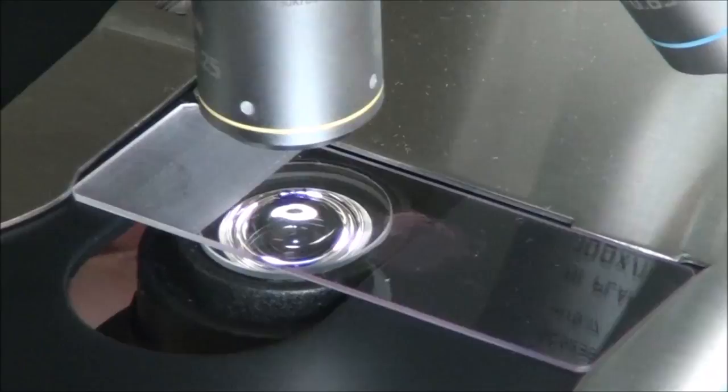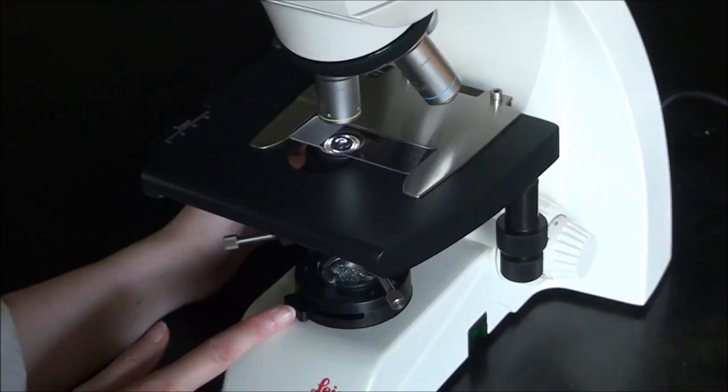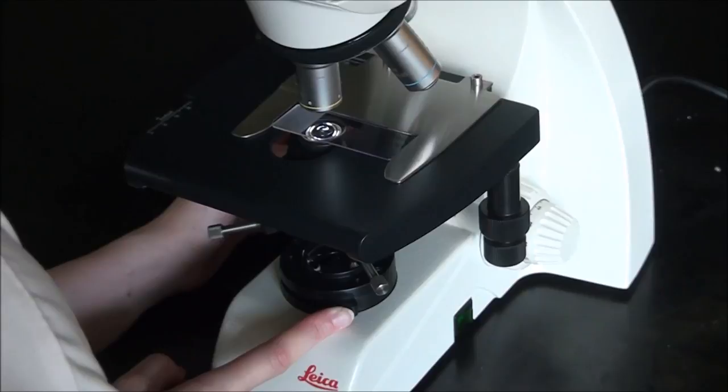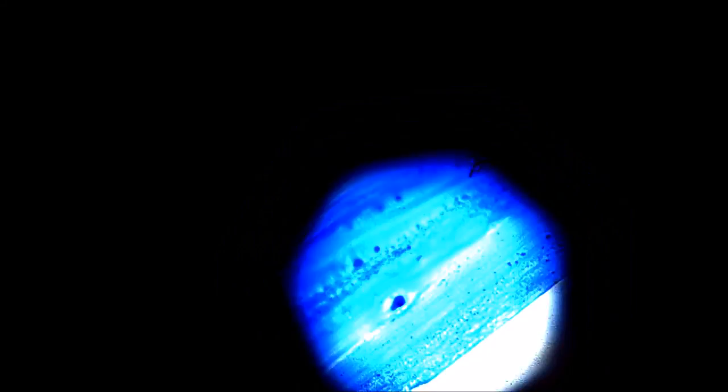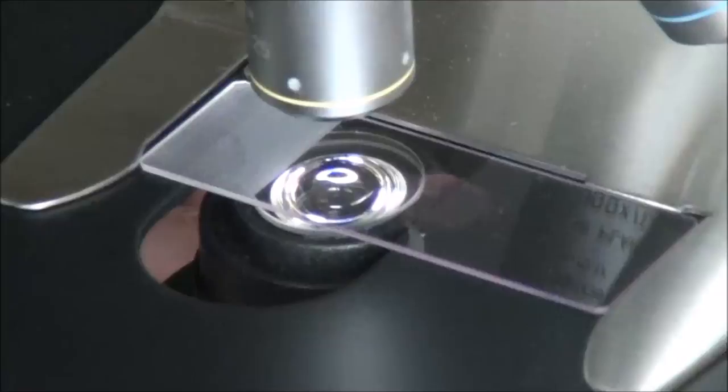To make sure we can align our lenses properly, it's important to adjust the field diaphragm at the very bottom. We're going to make sure it's closed all the way, and you should see a small bright circle. The truth is though that circle of light is not really a circle—it's a heptagon with seven sides, and we want to be able to see those nice crisp seven edges.